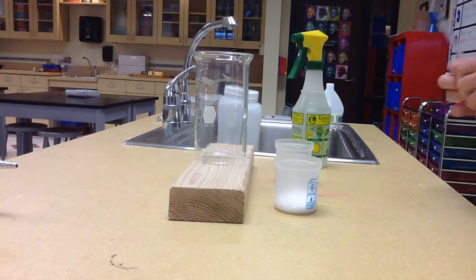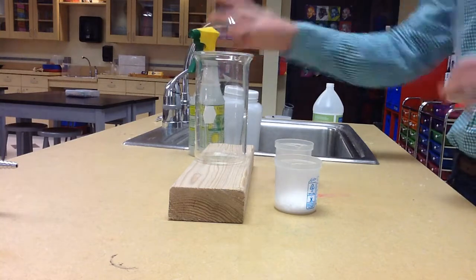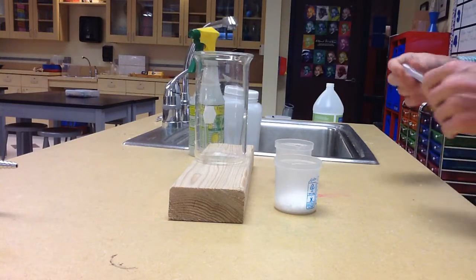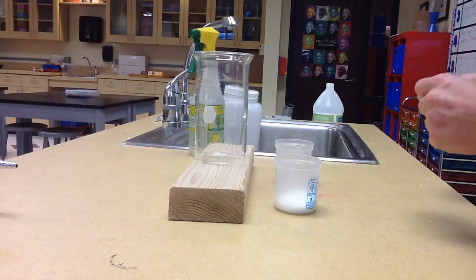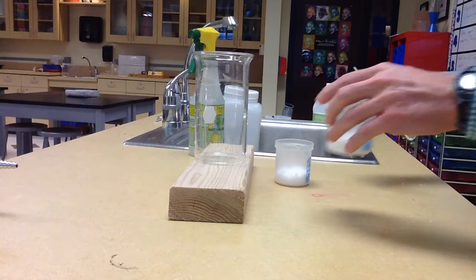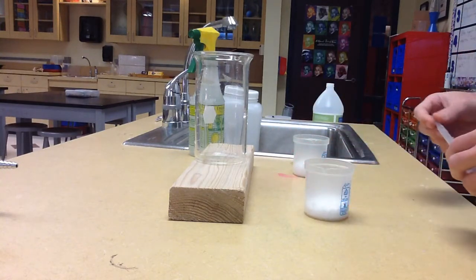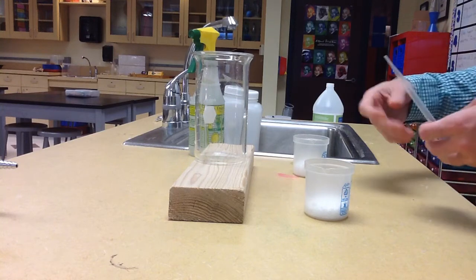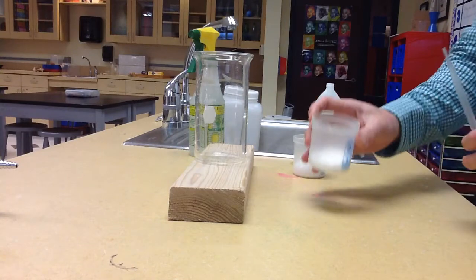Okay, one last experiment for our physical and chemical change test that I wanted to get posted onto the website today, just because we did it in class, and I think it would serve as a really good reminder for endothermic reactions for our students. So this is not an at-home lab. These chemicals are not something you can find in your house, but it is a really good example of an endothermic reaction actually taking in the heat from the surrounding areas.